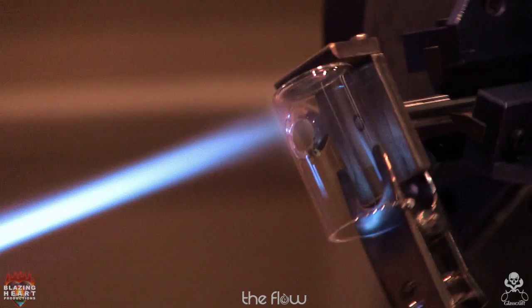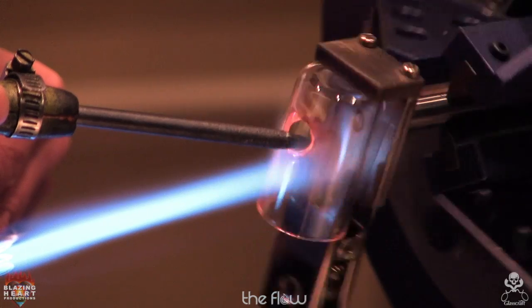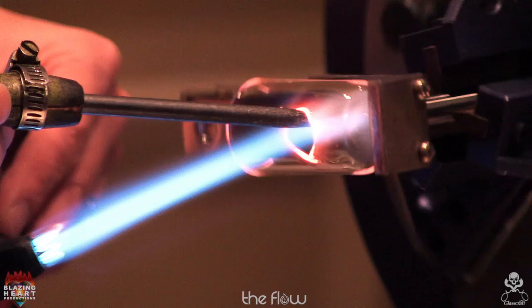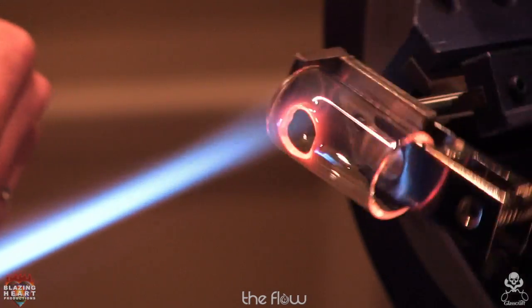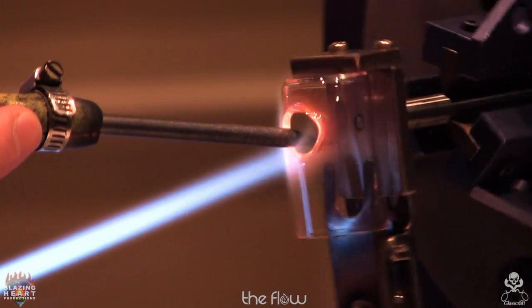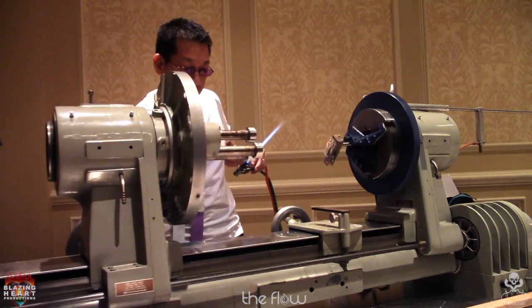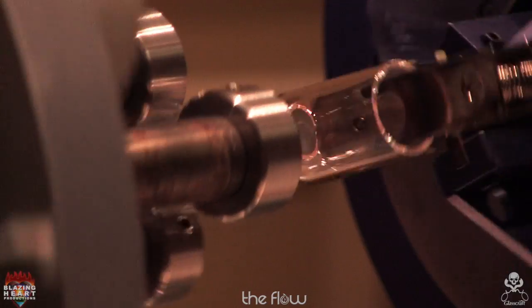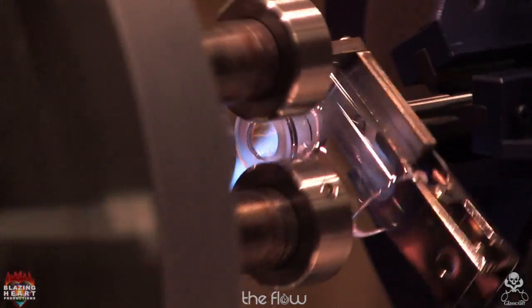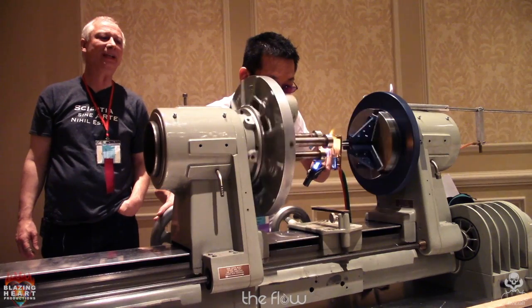All right, so he's got a hole pulled, graphite reamer. He's going to ream it open. So now he's got a little bit of a shoulder around the open edge. Most of the heat is on that shoulder.